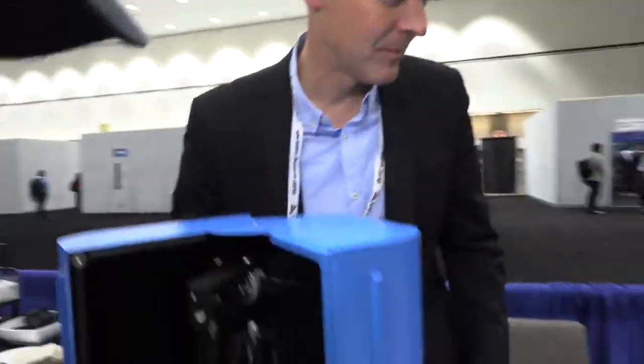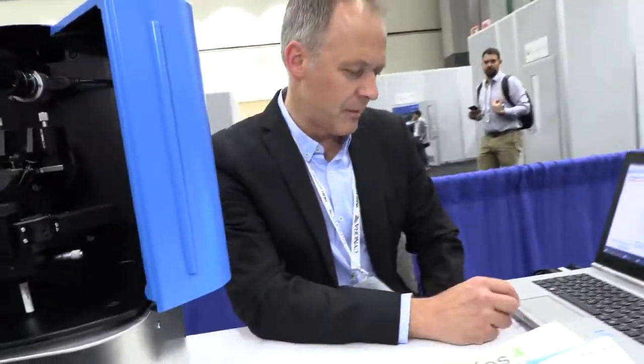So, what's your background? Where are you based? We're based in Winterthur, Switzerland. That's not far from Zurich. We are a spin-off company from Zurich University of Applied Science, and we have been around for 12 years. We are developing and then selling worldwide. We have distribution partners in Asia, and we have smart people that do user-friendly software. Because not only hardware, we started out with simulation software 12 years ago.